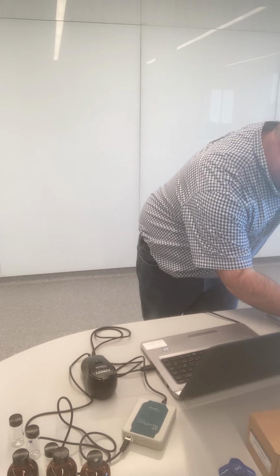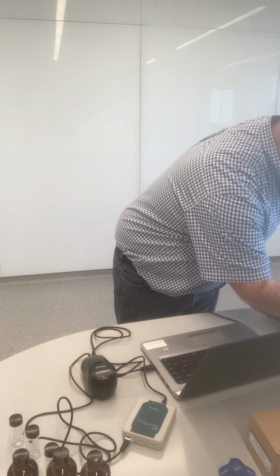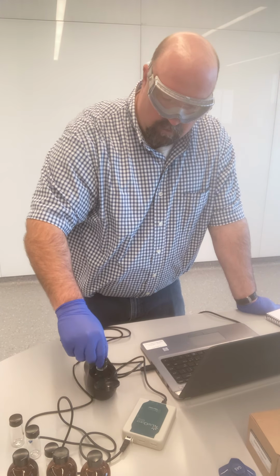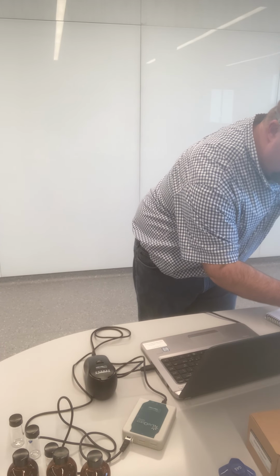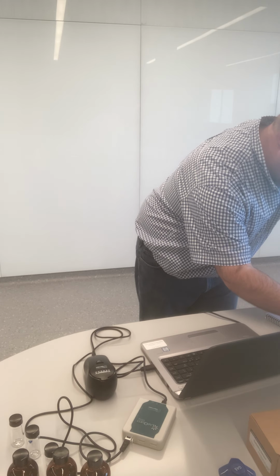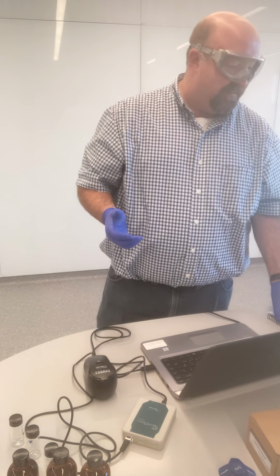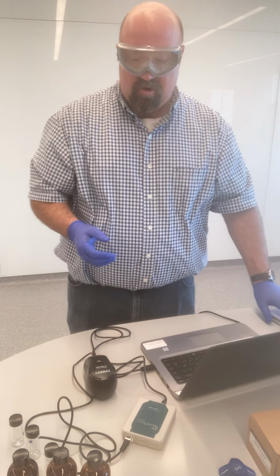Now I get a reading of 8.3 NTUs. Out and back in. .6 NTUs. Now again, this will all be in the spreadsheet. You don't need to necessarily record as I am speaking, but you can if you want, but it will all be provided in the spreadsheet for you.